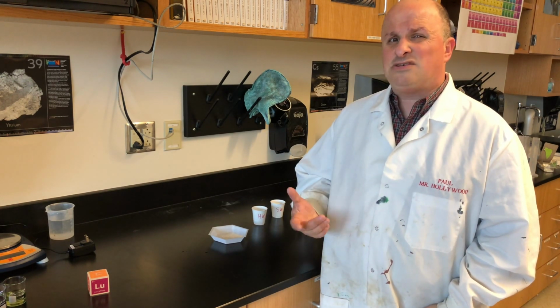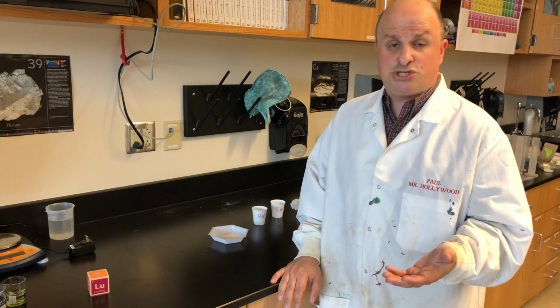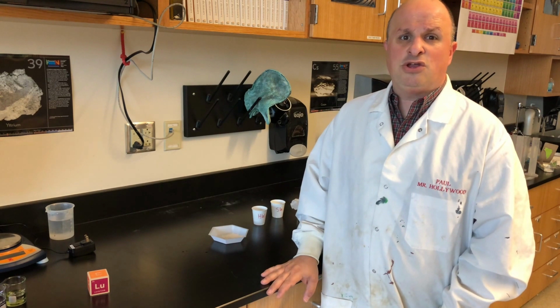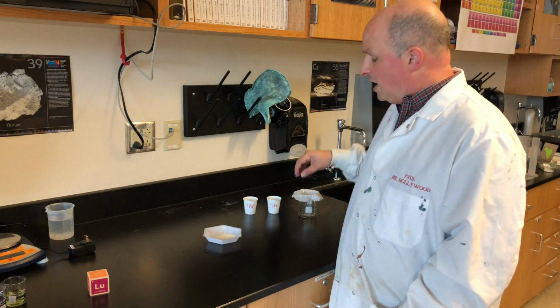Now that solid is a whitish color, and so some people think of it as being soap. But one of the biggest problems with this solid, which is soap scum, is that it doesn't dissolve in water. And because it doesn't dissolve, it sticks to surfaces in your house if soap and hard water have made contact with each other. So we're gonna make soap scum here in class today.